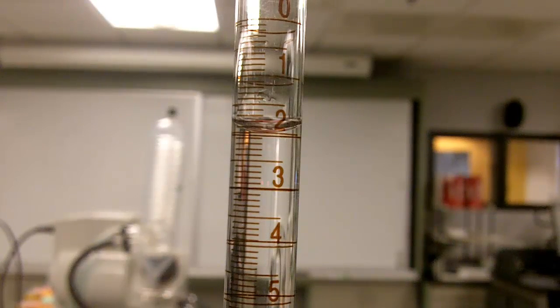One thing to remember about this when you're dispensing the chemicals is not to go below the 25 on the burette because there's no more graduations and you don't know how much has been dispensed. So always stay within the graduation range between zero and 25.